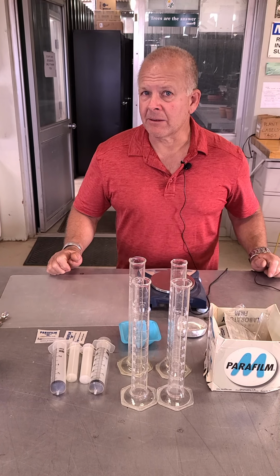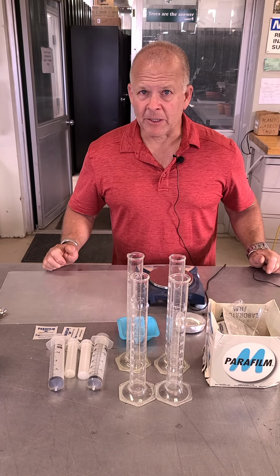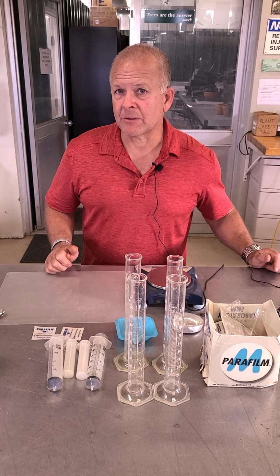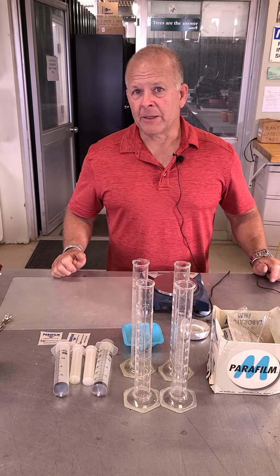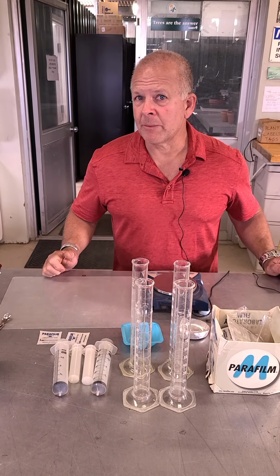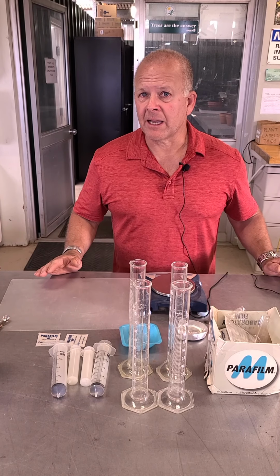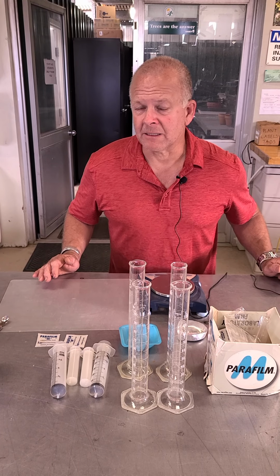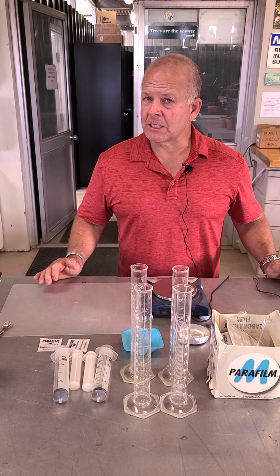We can easily do that, just like you can figure out how much volume you displace by measuring the water in a bathtub and then jumping in it and seeing how high the water goes. We're going to do exactly the same thing with our soil sample. We're going to have a known weight of soil sample, just like you know what you weigh, and before you jump into the bathtub, we're going to put in a known amount of water. You could put in an exact amount of water, and then measure the height before and measure the height after. That's going to be the volume that's displaced by the particles, the sand, silt, and clay in our soil. It's a particle density. So it's a pretty simple procedure.